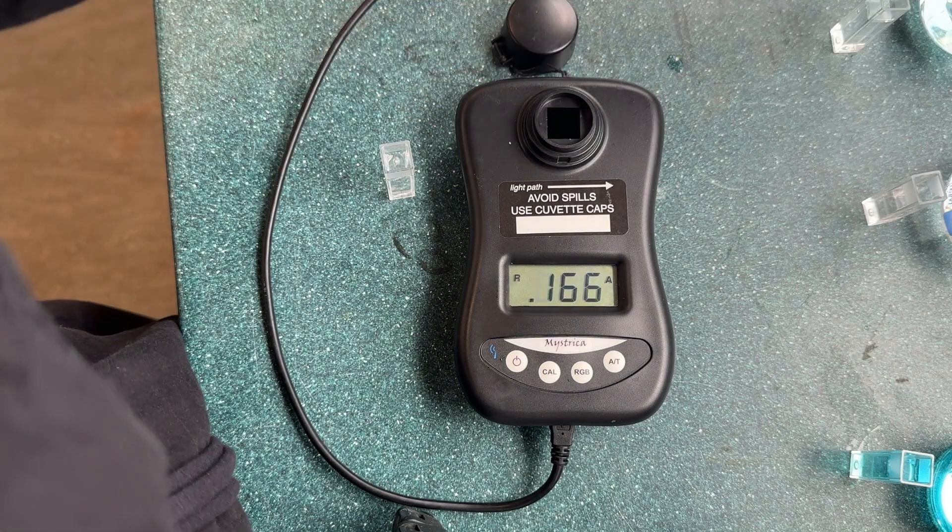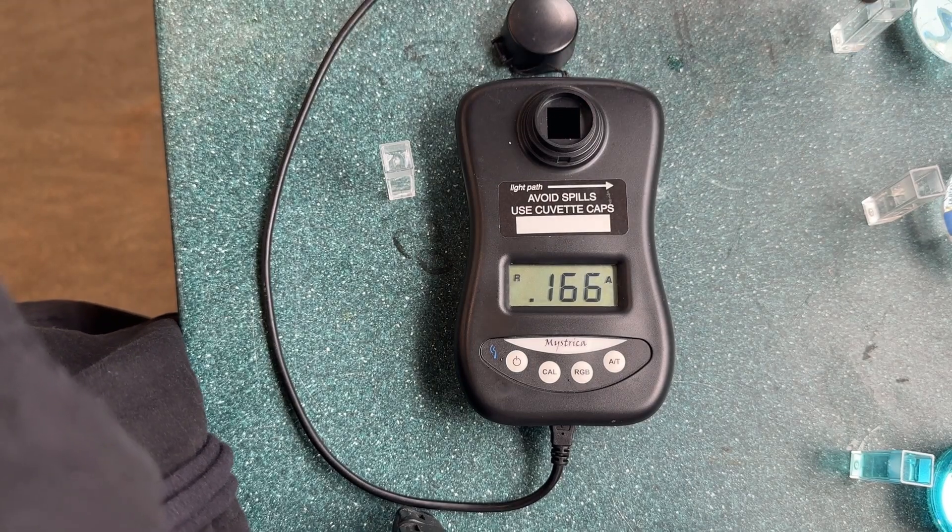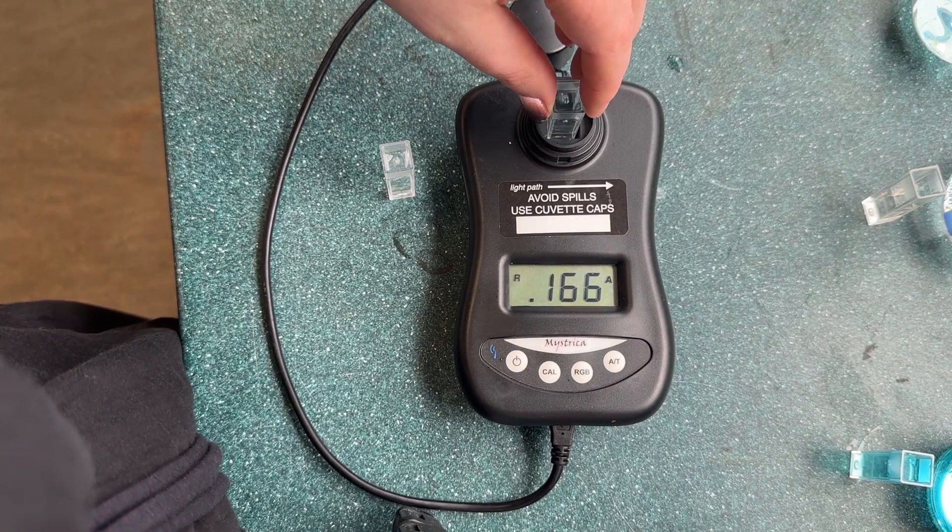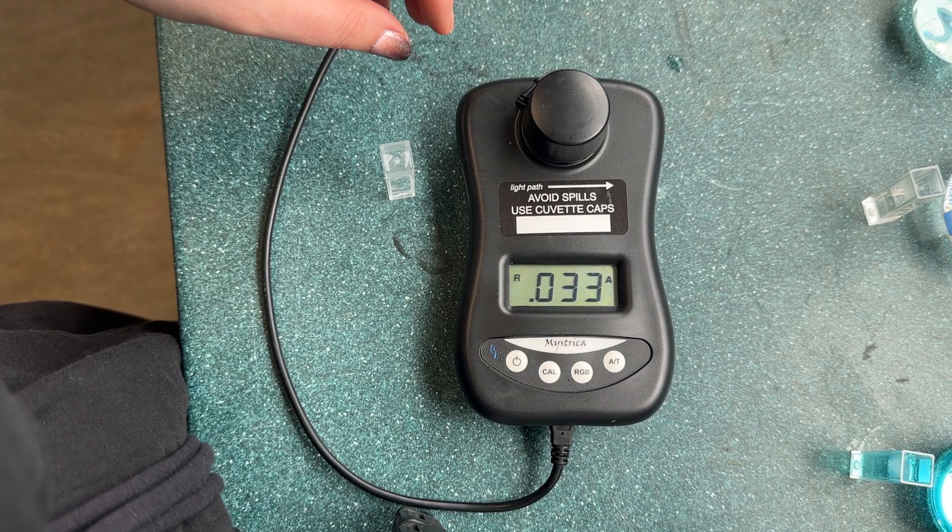We then repeat this with the next solution which had a concentration of 0.04. This has a reading of 0.33.